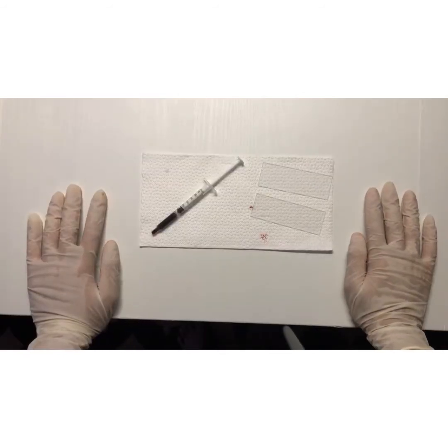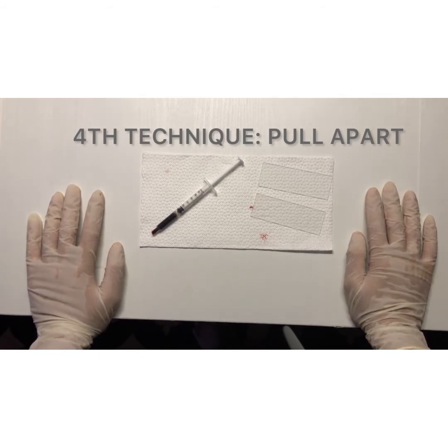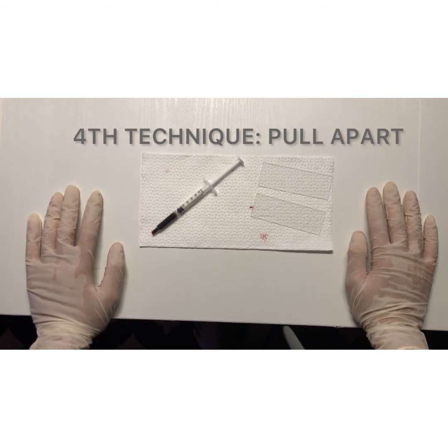So now I will be demonstrating the pull apart method. It is a procedure in which the specimen is dispersed evenly across the surfaces of two slides, and the slides will be pulled apart with a single uninterrupted motion. It is used for bone marrow aspirates.